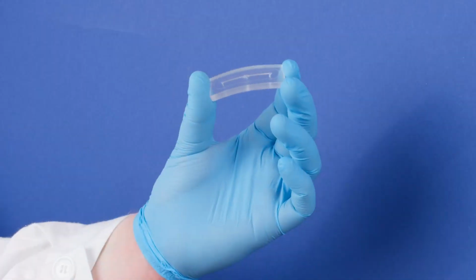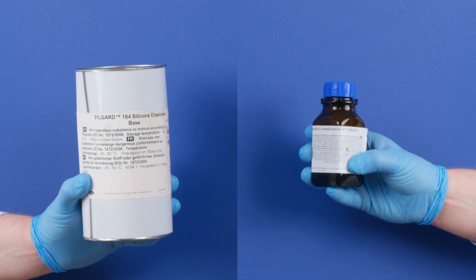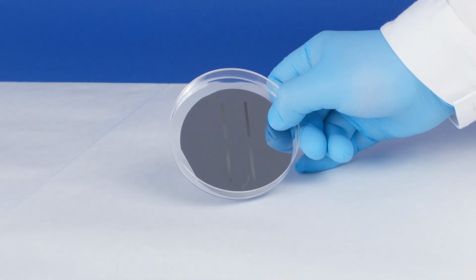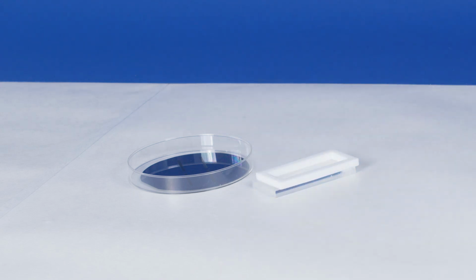The most frequently used material for microfluidic chips is polydimethylsiloxane, in short, PDMS. It's a biocompatible, gas-permeable, and transparent polymer that allows for simple fabrication. One needs to take two special liquids, the elastomer and the curing agent, mix them together, degas the mix in a desiccator, pour into the mold, and cure it in the oven at 70 degrees Celsius. The mold for PDMS casting can be made through photolithography in a cleanroom environment or with a simple computer numerical control (CNC) milled piece of plastic as such.